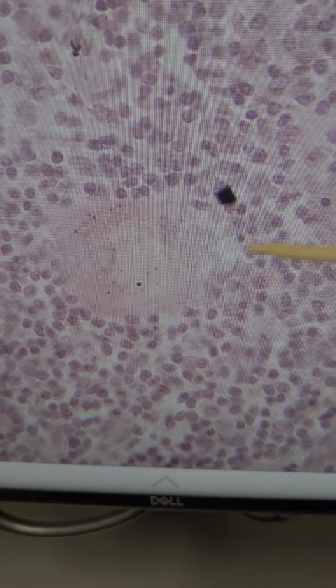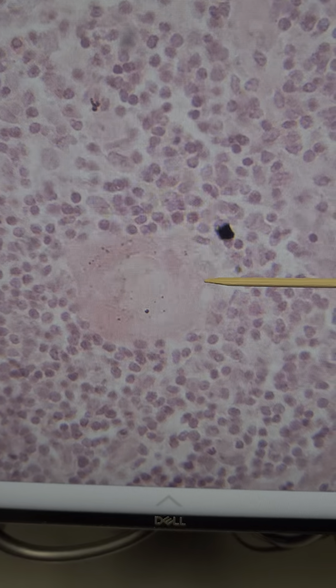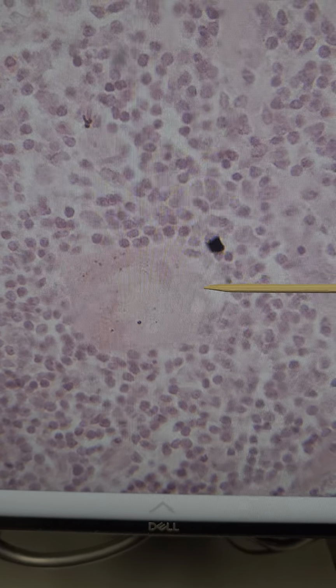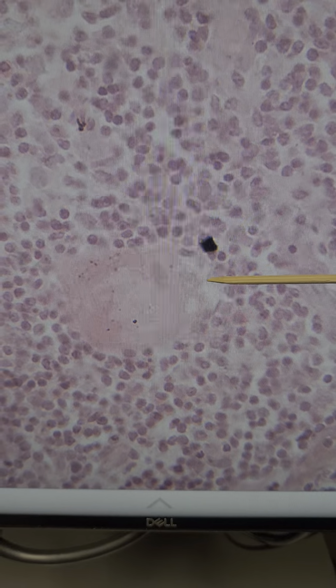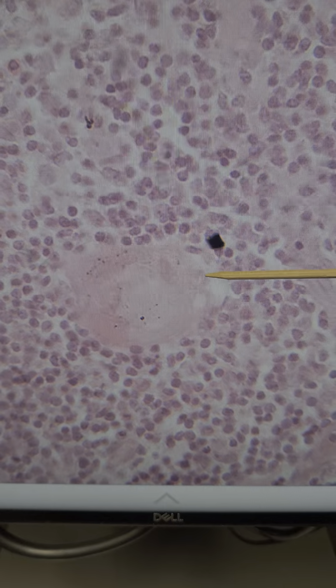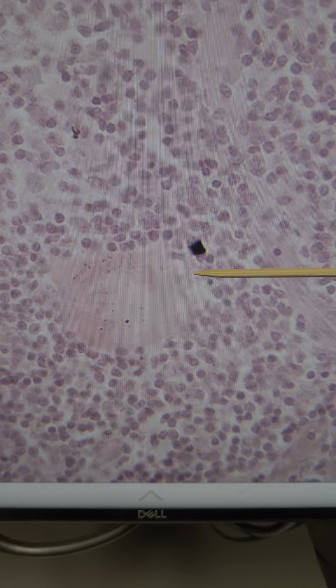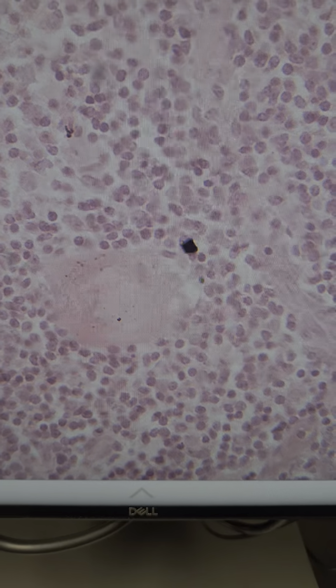So when I zoom in on this microscope, the thymic or Hassall's corpuscle is this structure here. I can just bring my phone closer. It gets a little blurry at that point. I'm going to go ahead and show you another Hassall's corpuscle here. And I'm going to go ahead and zoom in on this. And this is the Hassall's corpuscle at 400 magnification. I'm going to go ahead and get a different slide for the thymus to show you the difference. By the way, 400 magnification on this machine is a lot different than our microscopes. So please look at those differences when you look at these slides under the microscope.